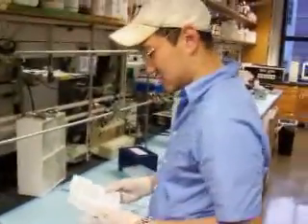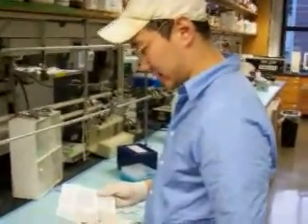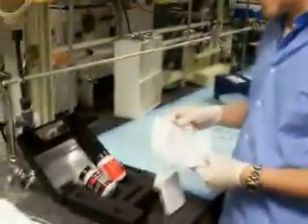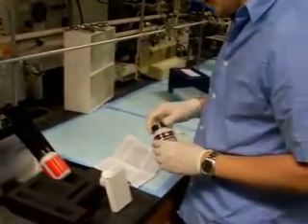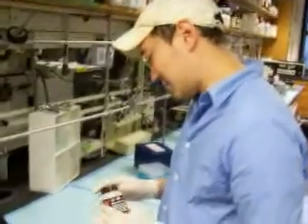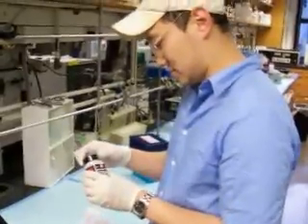I haven't handled a situation quite like this before, but I'm deeply committed to not only lab cleanliness, but lab safety. So, based on the instructions, the first step is to accumulate as much of the droplets of mercury into the pipette and dispose of them into this red container. Whatever I cannot collect, I will use what is described as an approximate weight equivalent of Mercurisorb on the remains. I'll collect the mercury onto the Mercurisorb by brushing, and then I will shovel the mixture into the waste. Sounds like a plan.